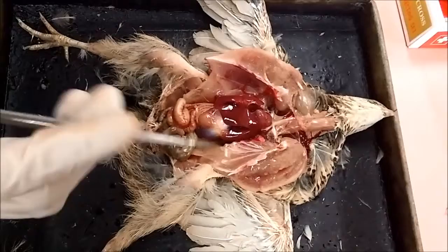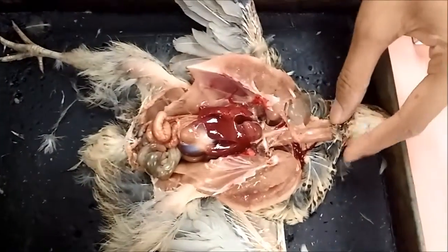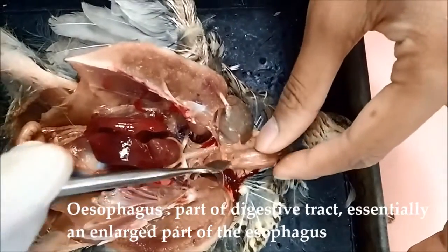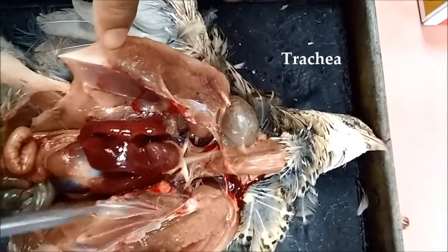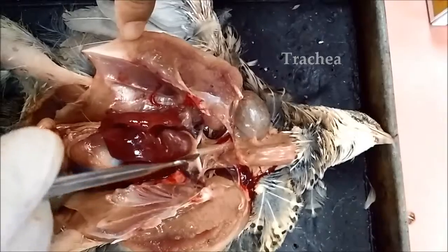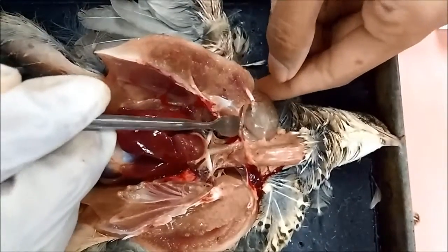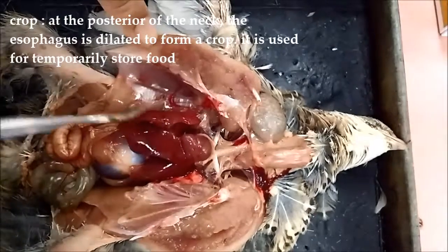Okay, now we are going to see the internal anatomy of the bird. So as we can see here, the first one from the top is the esophagus, and next to the esophagus is the trachea. Here, the long one. It's connected into the heart and also the lung. Okay, so next, esophagus. This is the crop of the bird.